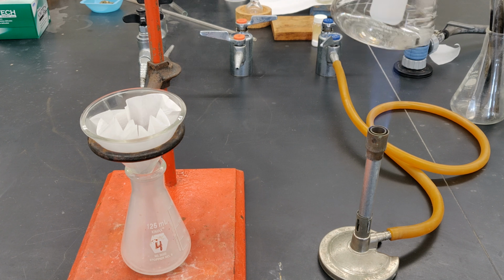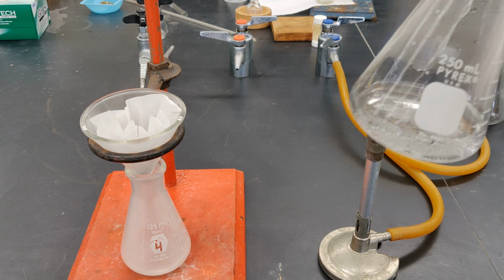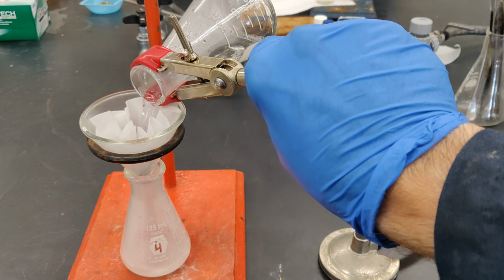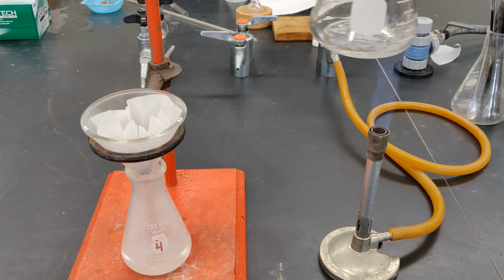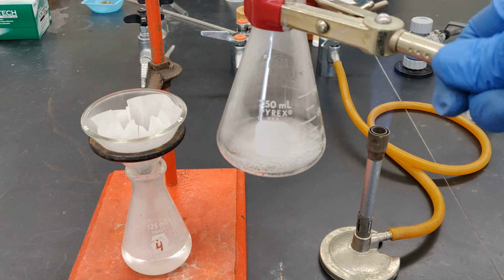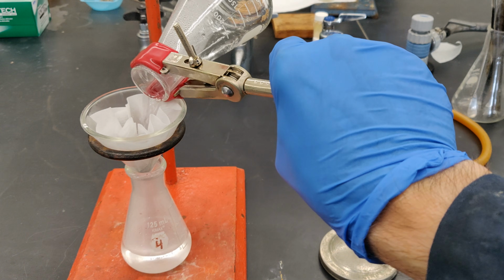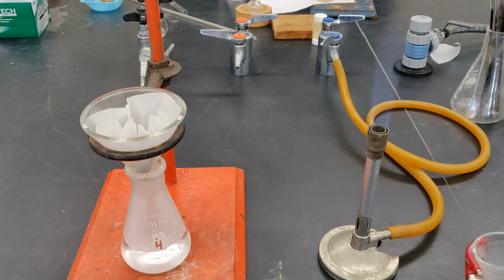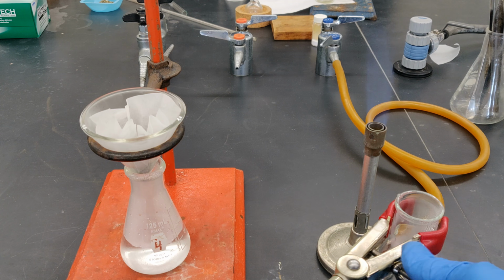To prevent precipitation of cinnamic acid from occurring in the filter paper while you're filtering the hot liquid in several portions, keep the remaining unfiltered solution in the Erlenmeyer flask hot by heating it briefly over the flame while you wait for liquid to pass through the fluted filter paper. When finished filtering, remove the clamp from the flask before setting it aside, but keep the burner lit for the moment.